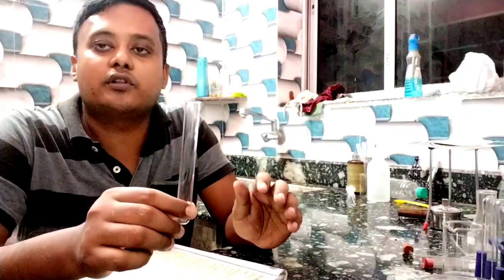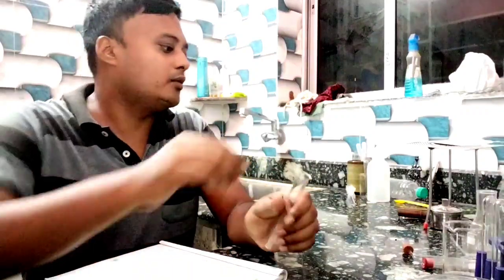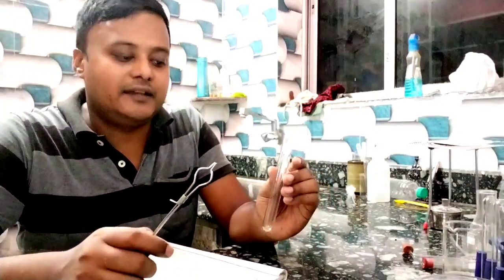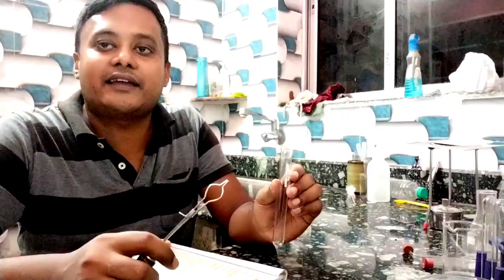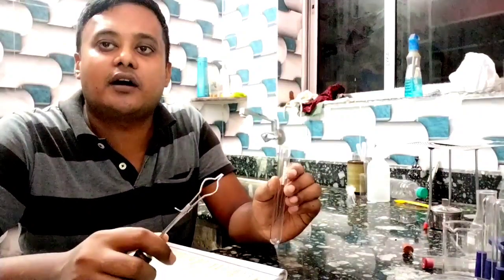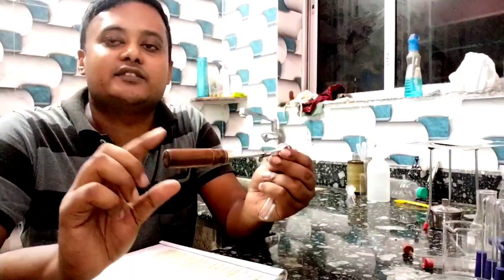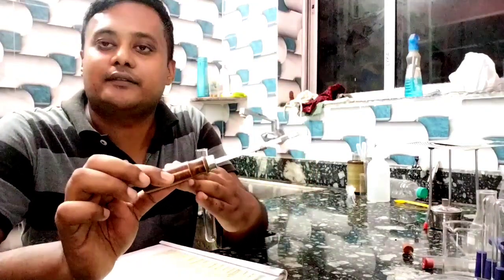Next one: test tube holder. When we heat any chemicals, or when we take some corrosive chemicals like concentrated H₂SO₄ or concentrated HCl — any concentrated acid or harmful chemicals — always use a test tube holder. This part is metallic and the handle is wooden, so that heat cannot transfer to the handle.